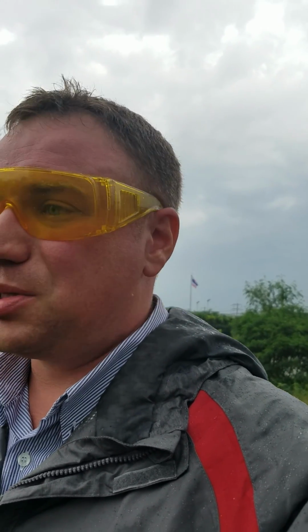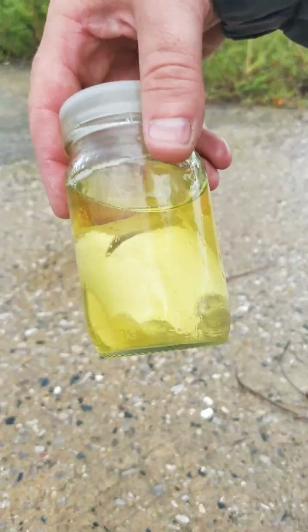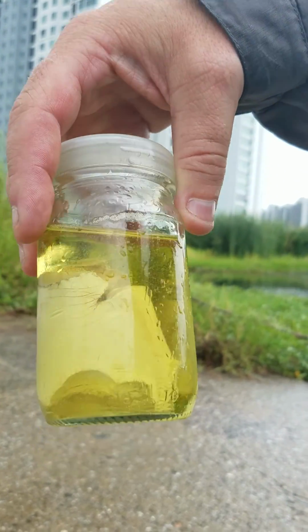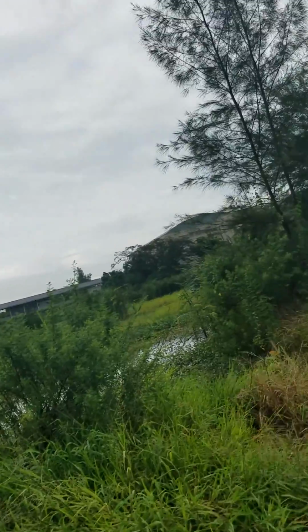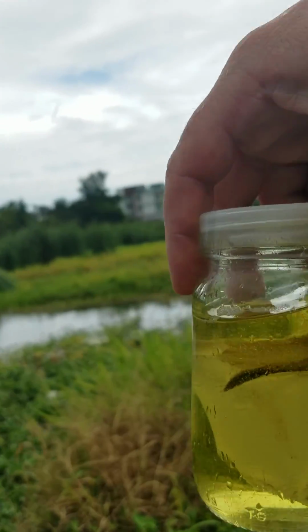So we actually did order real sodium, which we need to return now, but there's still no safe place to put this right here, which is our two remaining lumps of sodium. So we're gonna have to dispose of it. So I have volunteered to dispose of it by going out here to this empty lot. And I'm just gonna chuck these things in the water one at a time.